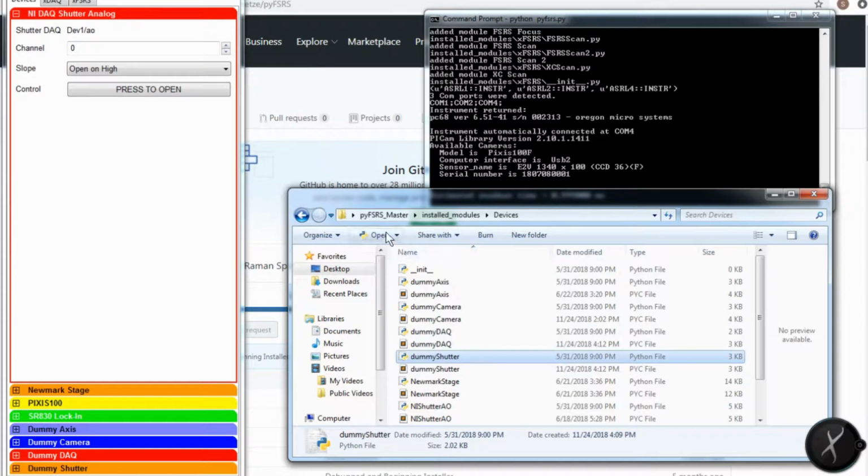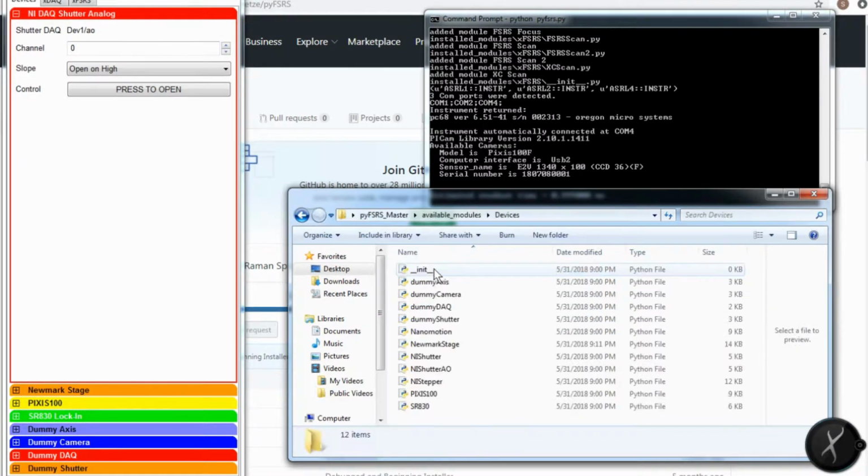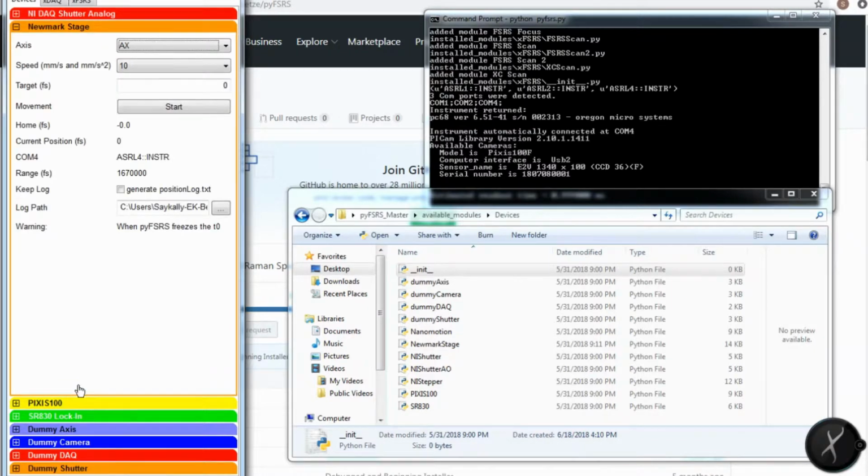Then when you want to add new devices, you navigate to available modules, and you can copy and paste these real devices into installed modules. So you move them from available modules to installed modules. Here first I'm showing you the shutter, and so when I click open, you can hear it click. Next I'm showing you the Newmark stage.